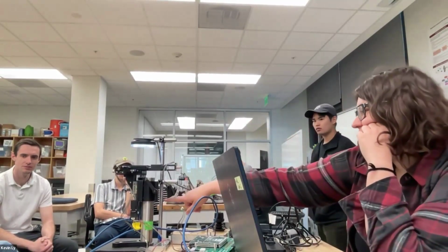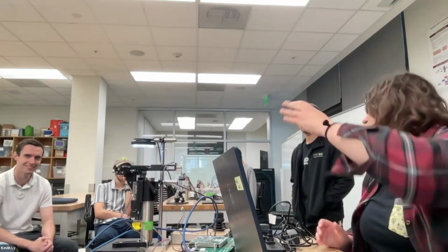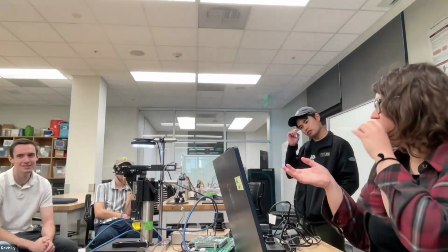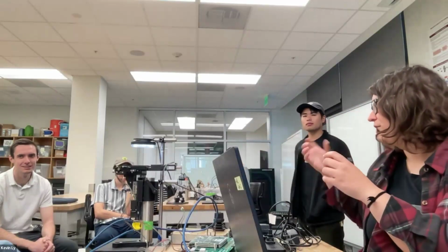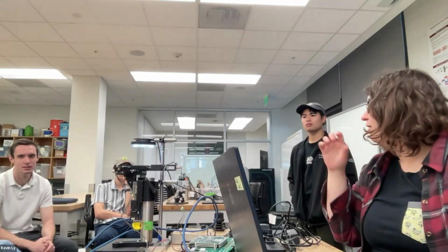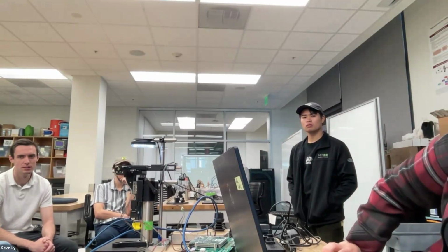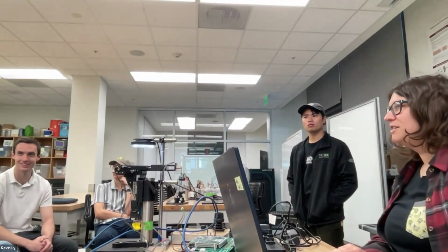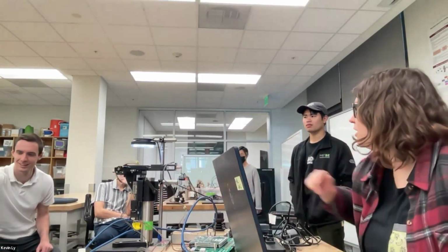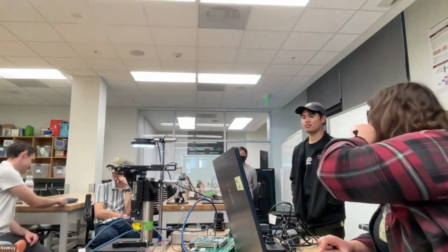To do that, we can have different versions of this optical train that will excite, like an epifluorescence equivalent. So it'll excite a certain color or wavelength of light, and then have a mirror that filters out the other things, called a dichroic mirror. And then you'll be able to look at it that way. So there's a few versions of that. We haven't used them as much, I think, on SQUID, but it's definitely possible just by changing out this optical part. And you can still use a monochrome camera to be able to detect that.